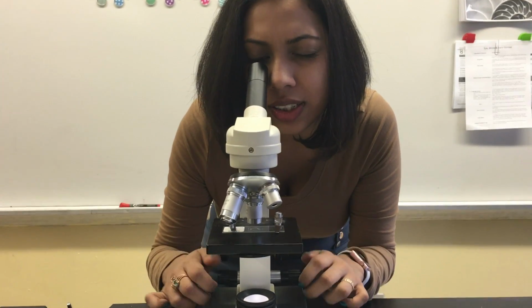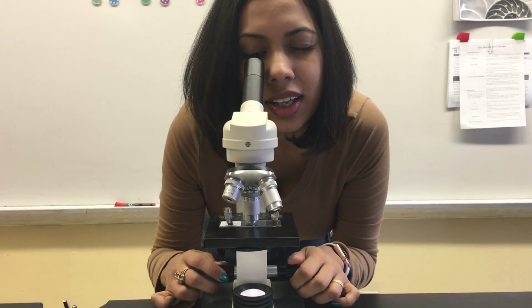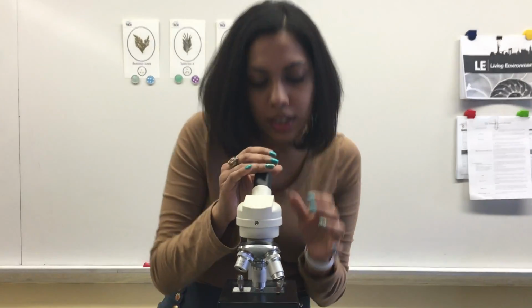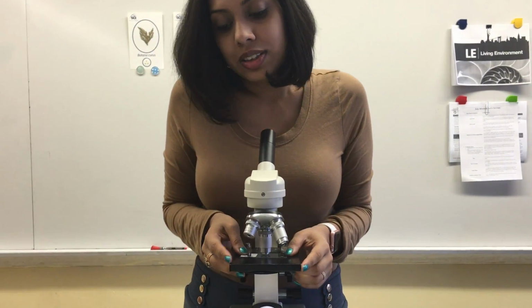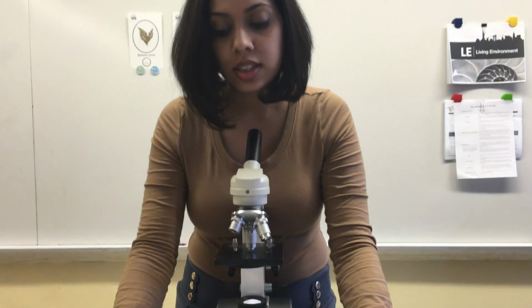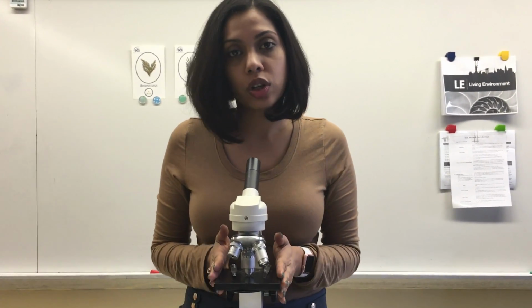And once I have it perfect and clear, I can make it bigger yet again. And then I can magnify it until it's clear, move the fine adjustment until it's clear, and then I should be able to see the plant in the highest possible magnification. That's how slides are used in the microscope, and then you will do the same process for X, Y, Z. Once you are done, your data from this goes on underneath the microscope column on page 8. You can draw directly what you see inside the microscope onto that column for each one of these, or you can write what you see.